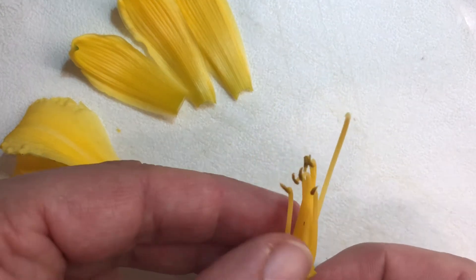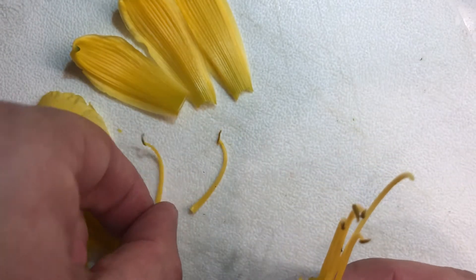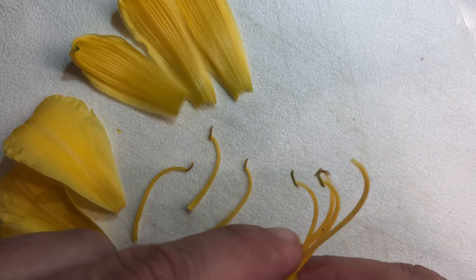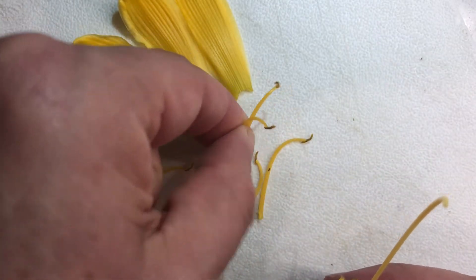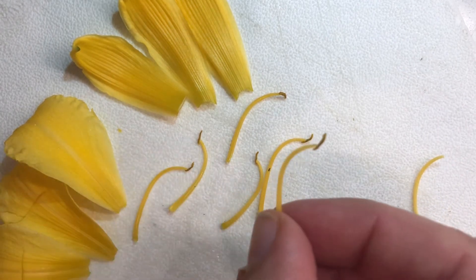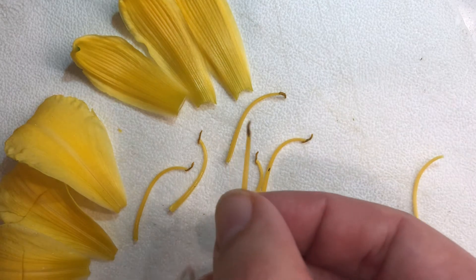I'm going to start by peeling off the stamens. The stamens have the filament, which is the long stem-y part holding up the anthers. The anthers are the tips of the filaments right at the very top, and that's where the pollen is on the inside of those anthers.